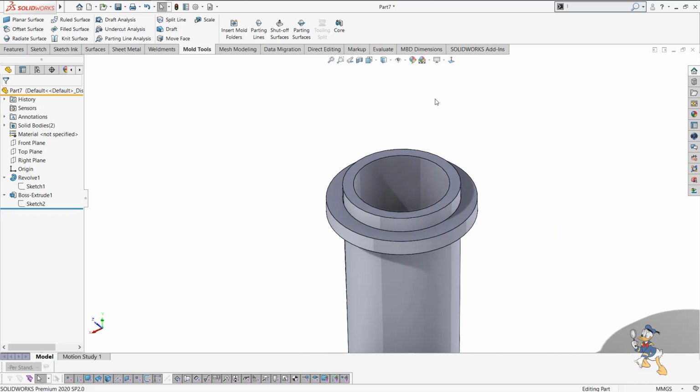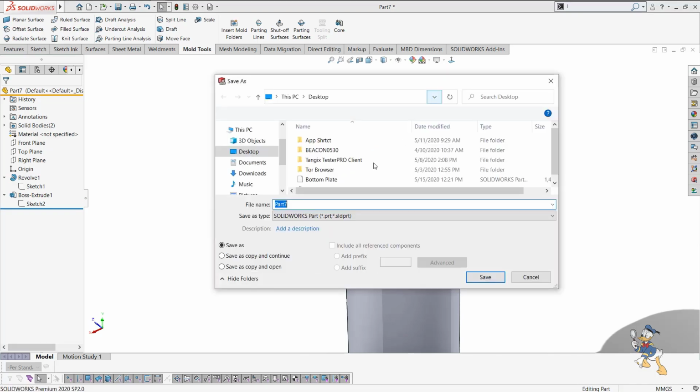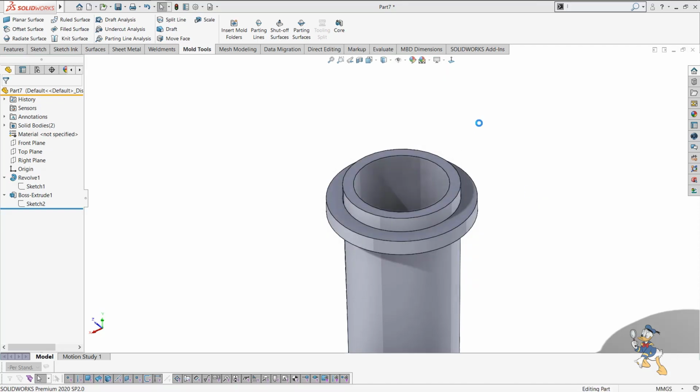now we can save it with a name like 15 ml tube and that stuff. So this is how we can design a plastic component in SolidWorks. This is a very simple component, and I just showed you the important features of mold design or plastic component design, where we need to check the draft value, and whether there are any undercuts or not. So these kinds of features are available in SolidWorks.